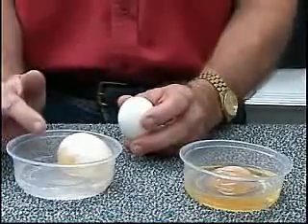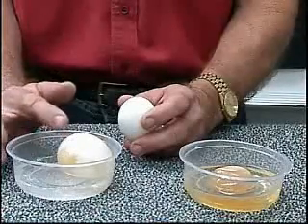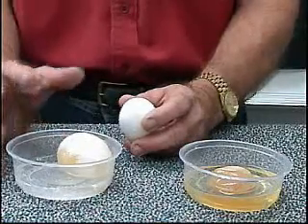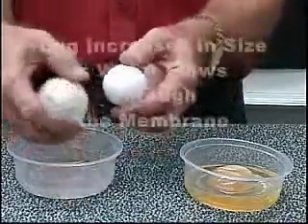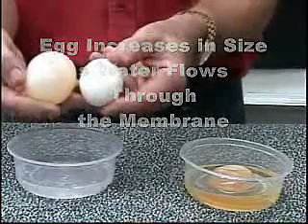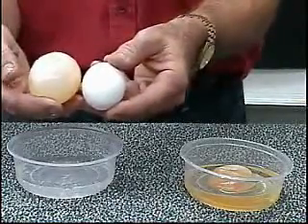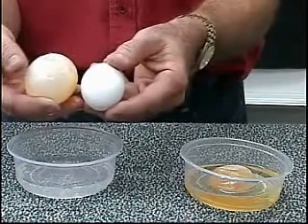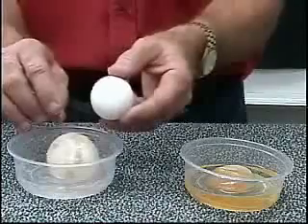As a result, water passed osmotically through this selectively permeable membrane, and the cell actually increased in size. If we look at these two eggs, I think you can see fairly clearly the original size of the egg and what we have after several days in that water solution. So this cell has taken on water.